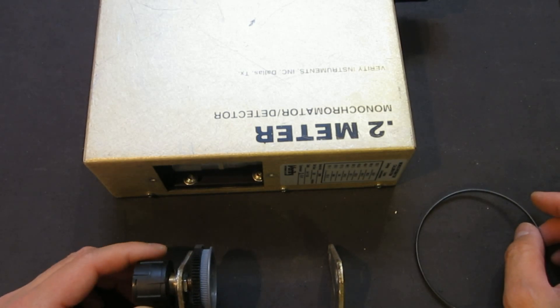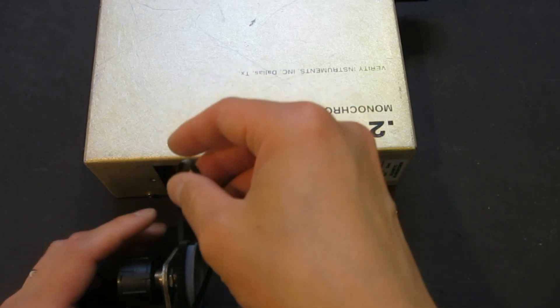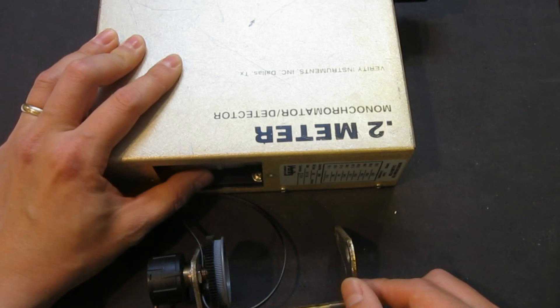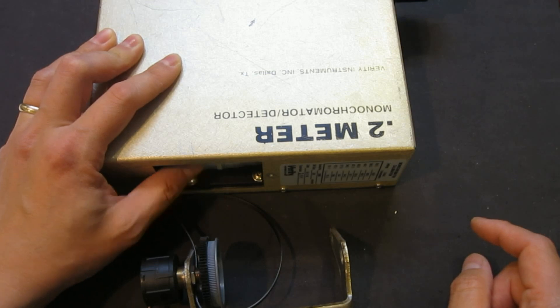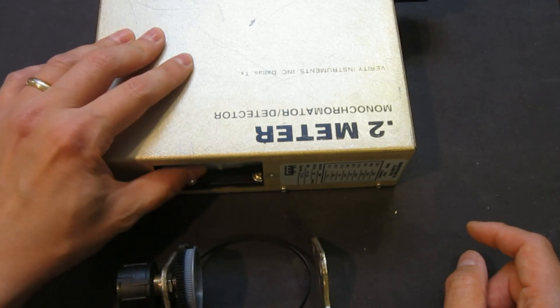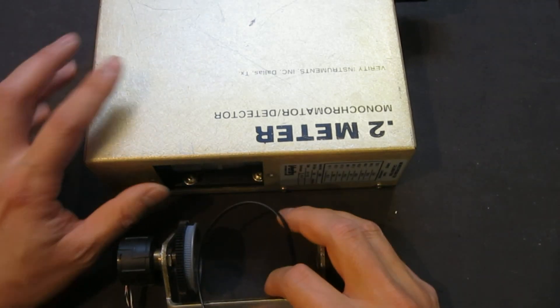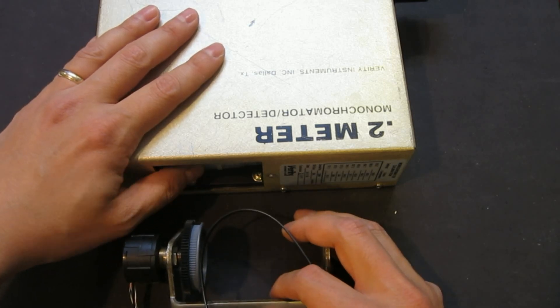This also means that I can probably just do this manually without having to have a mechanism that moves this laterally when you turn the dial, because what's happening is that as you turn it, this moves back and forth depending on what wavelength you've dialed in. So probably this will be sufficient for me to manually adjust this — one hand holding this encoder and the other hand adjusting the wavelength.